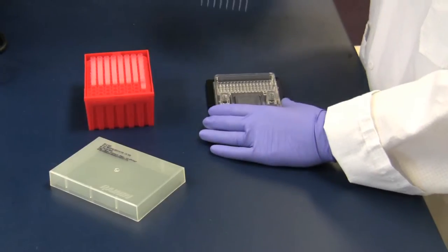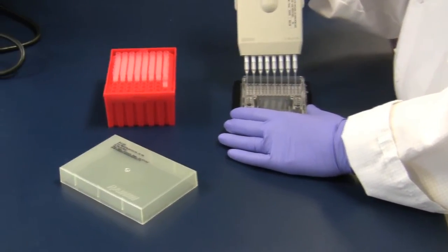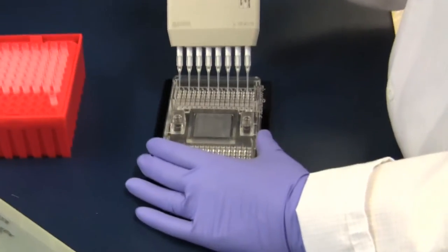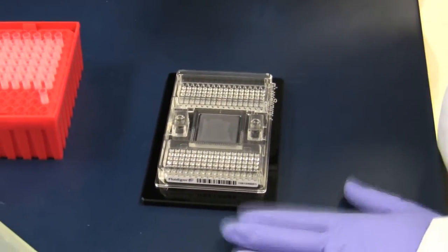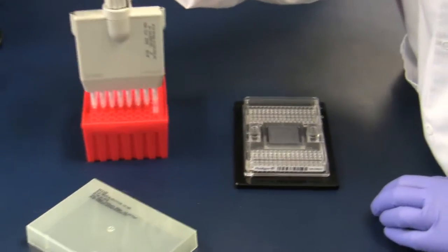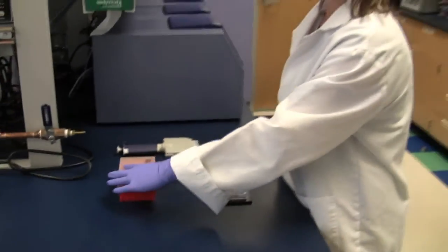And then on the sample side we will do the same thing. We will load our samples into the inlets on the sample side. There are 12 pipetting steps for this chip in total. So it's very straightforward and simple, and it takes approximately 10 minutes to complete.